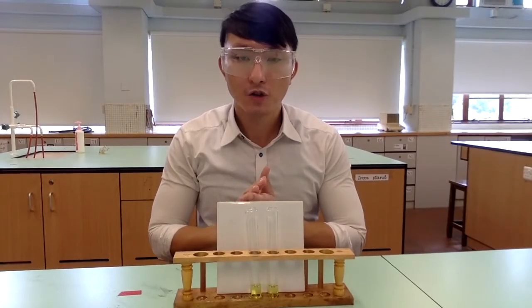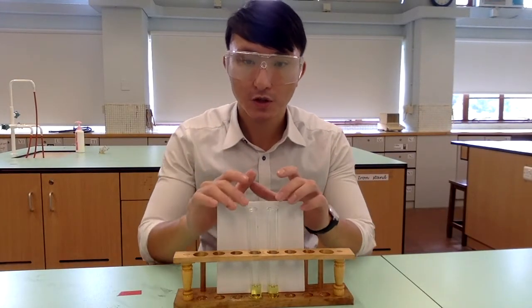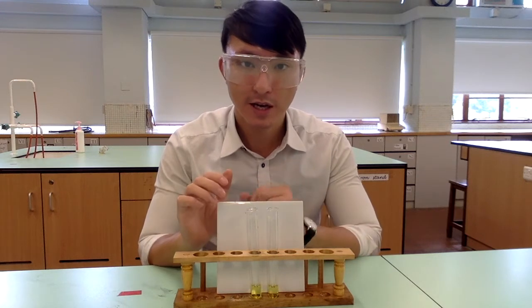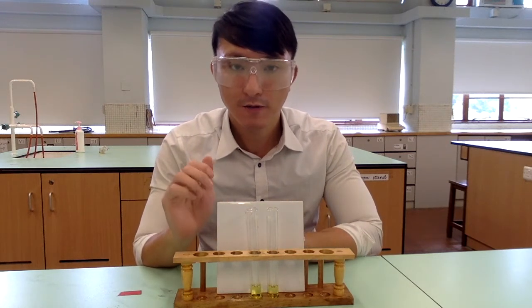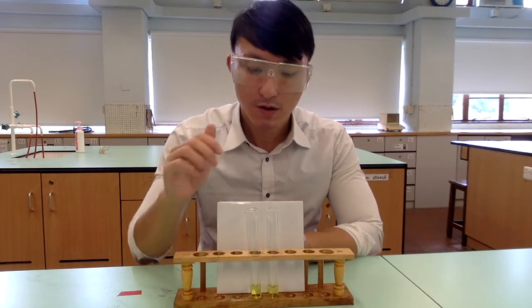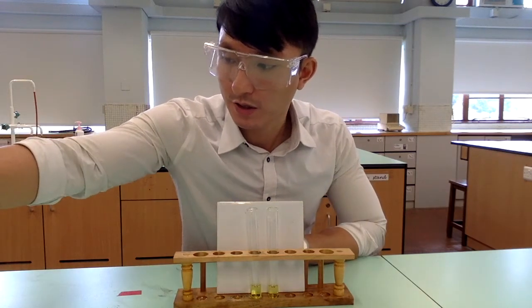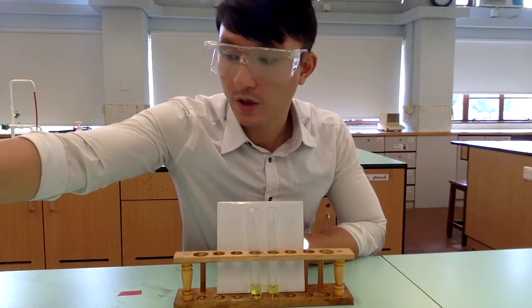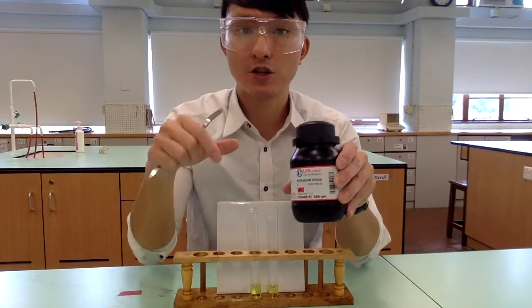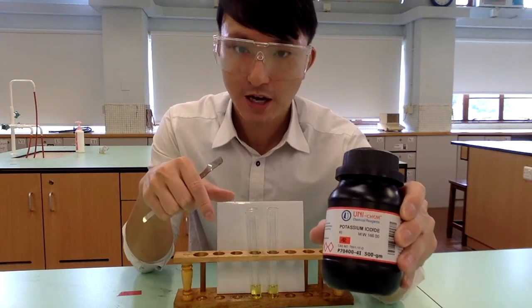Moving on to Part B. We have two test tubes, each containing dioxo-vanadium(5) ions. To one of those test tubes, we are going to add a small spatula measure of potassium iodide.